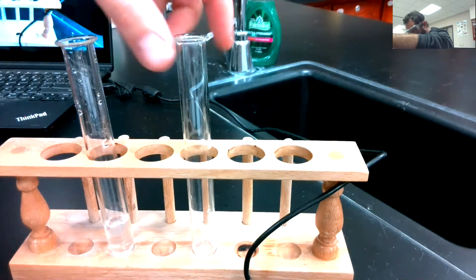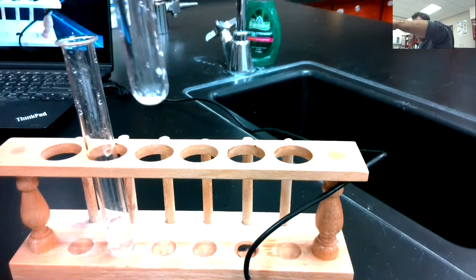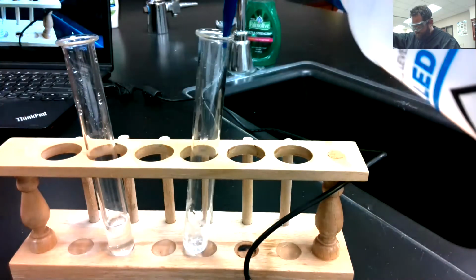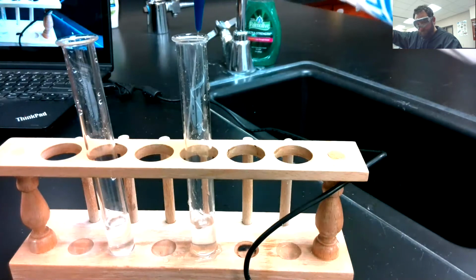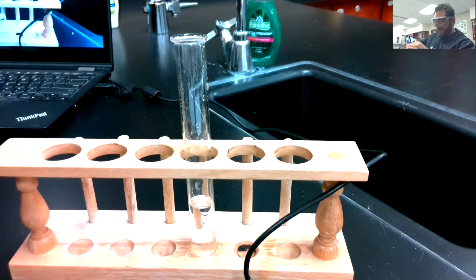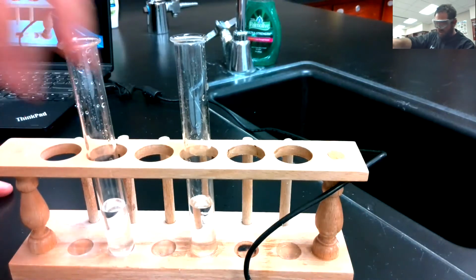It's amazing in chemistry how many things look like just that basic white salt. So you guys can see it there. Now we'll add some water. A little more water to this one, make sure it all dissolves. Not too much of that calcium nitrate left, but not all of it's dissolved yet.